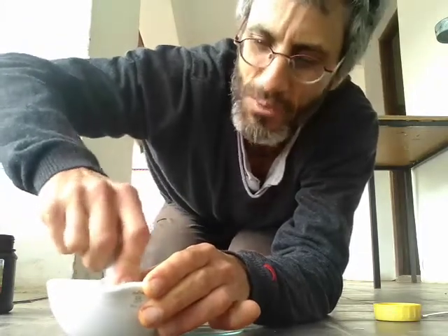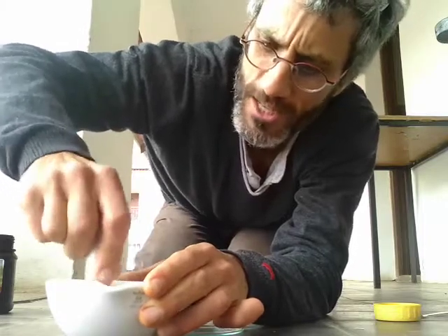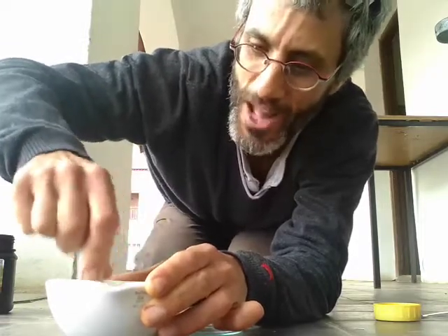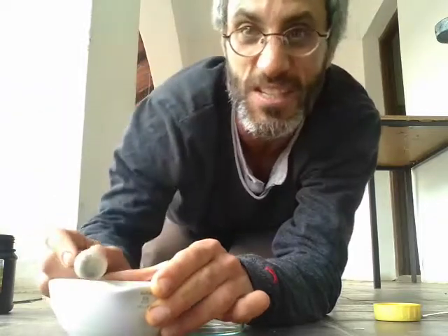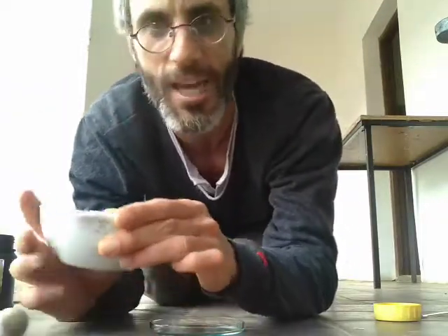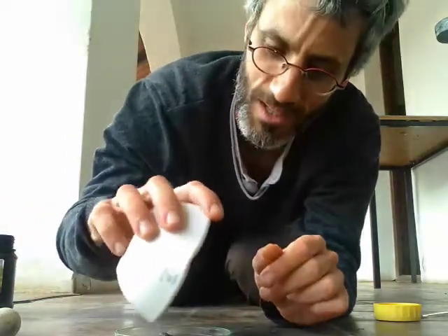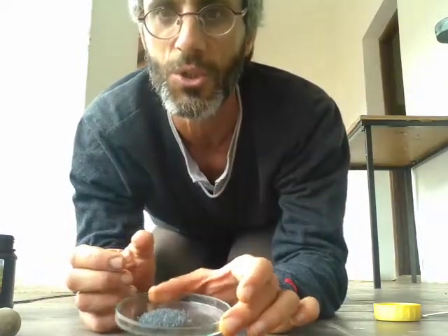Remember what sublimes means? Sublimes means that it goes from solid straight to gas. If I heat that solid, and I think that's what I showed you, I just heated it up, it went to that beautiful purple, call it purple haze, which is gas form, okay? But I'm not going to heat it up today. The opposite. I'm actually going to give it some water, okay? But it's not that the water causes it to sublime. I'm just going to show you that, okay?